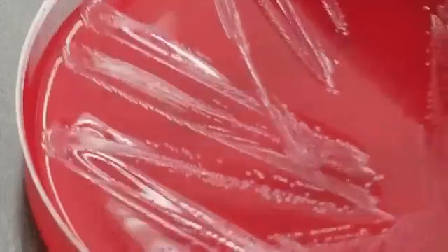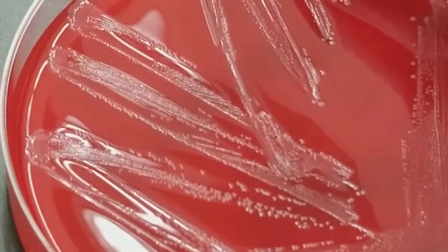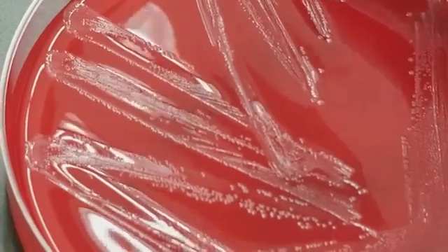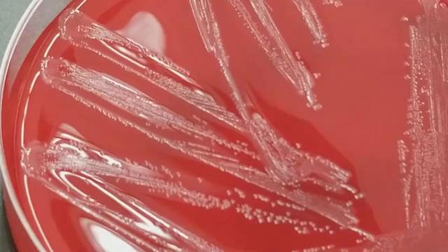This one is from a butt. I think it would be around the anus. I'm assuming it's a swab. It doesn't really say what the type of specimen is, just that it's a buttock. So it could be some type of boil or something on the buttock, but I would think that this is most likely from a pregnant woman. So this is actually group B strep.